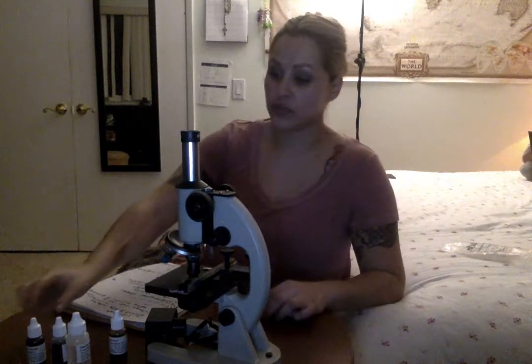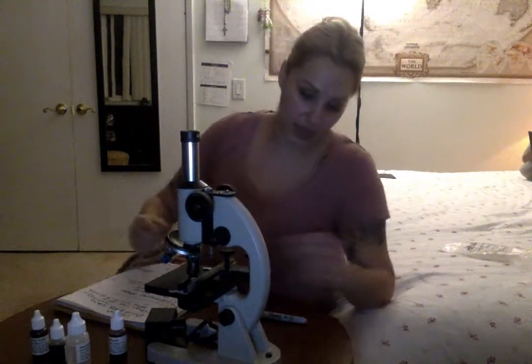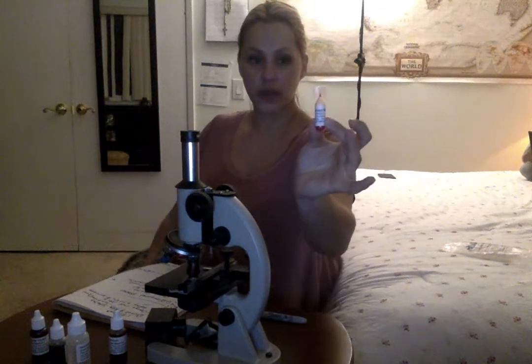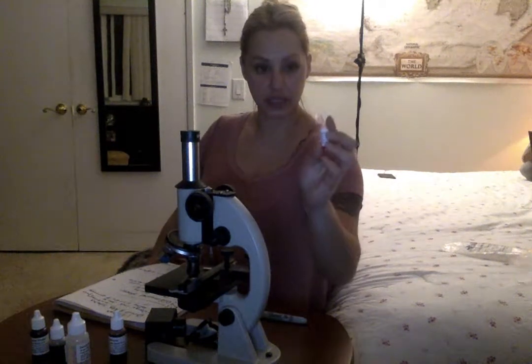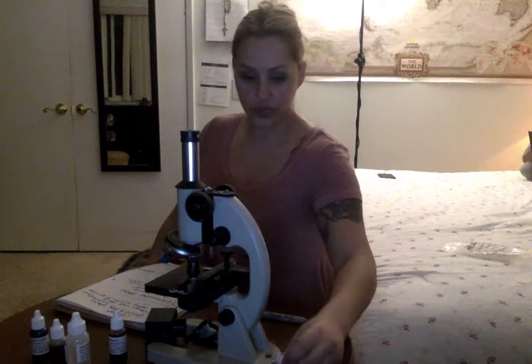One is a crystal violet stain, which I have here, and it is a direct stain. The other one was a Congo red stain, which is this one here. We didn't use too much of it, and I wasn't sure if we had to keep it or not, so I kept it and topped it with a piece of tape so that none of it will get out.